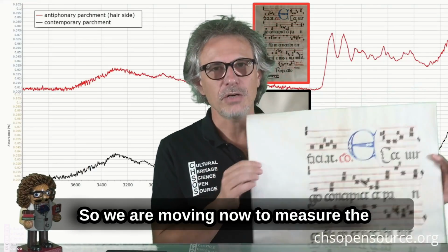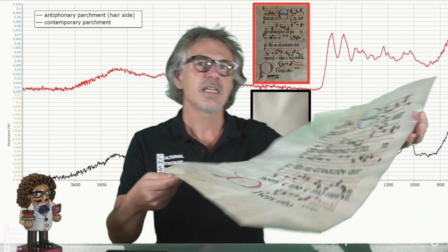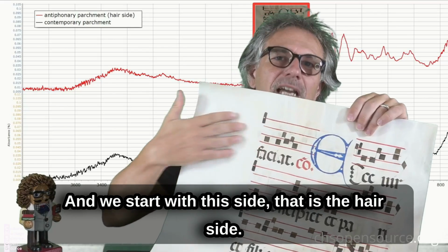So we are moving now to measure the actual parchment that we have in our lab, and we start with this side, that is the hair side.